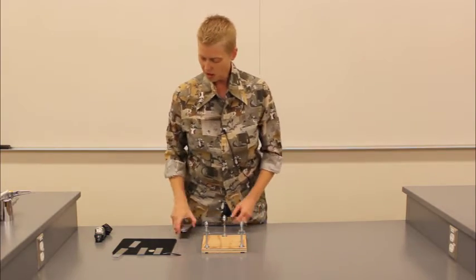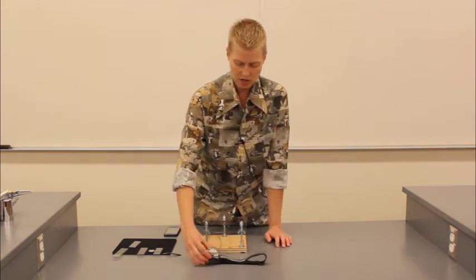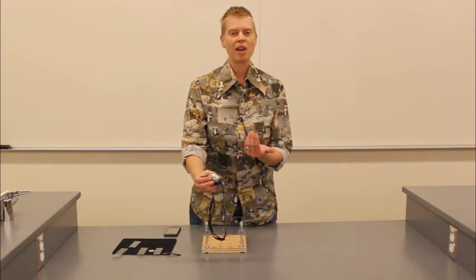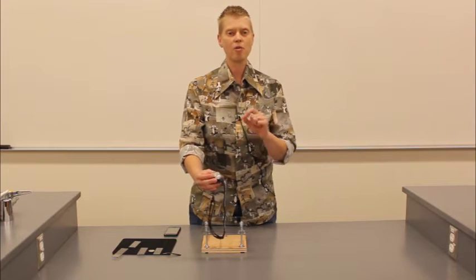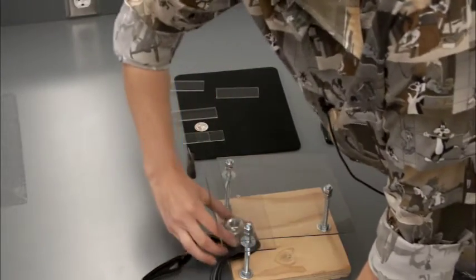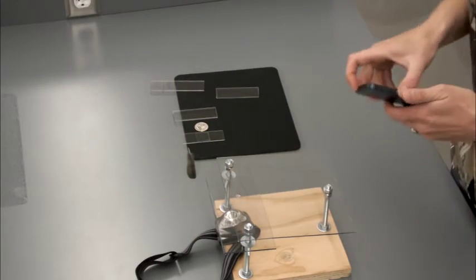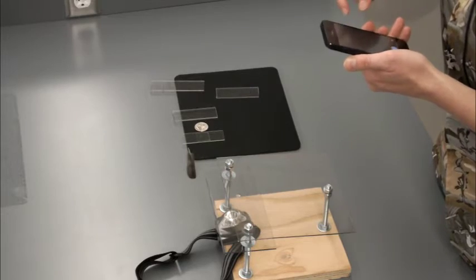One other item that is useful to have, you may not use it for all the specimens that you have, but any kind of an LED light. So oftentimes when we have samples that are darker or thicker, if we shine a light up through the bottom of it, we can see more detail in the specimen that we're looking at. So we will put that right under here so that it's kind of underneath our focusing lens there. Get your cell phone, any kind of a cell phone that's got a decent camera on it works.